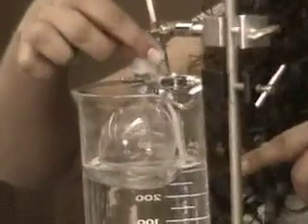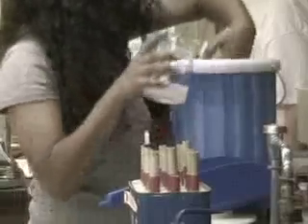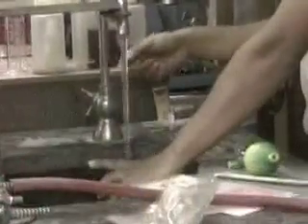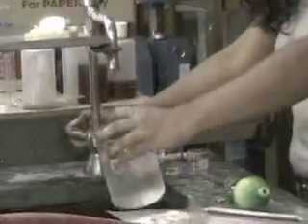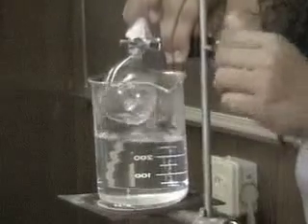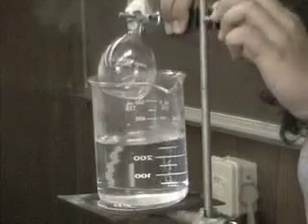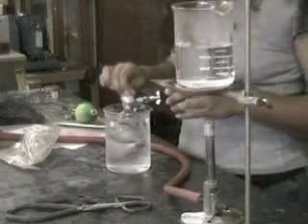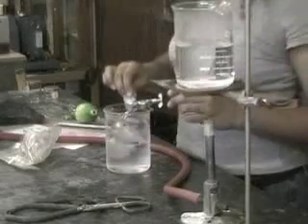After the heating is completed, we seal the top, here with parafilm, to keep out other vapors from the flask. Prepare a cold water bath. The cold water bath will cool the vapor, turning it into a liquid inside the flask. We let it cool while it is still sealed. We see the liquid collecting in the bottom of the flask.